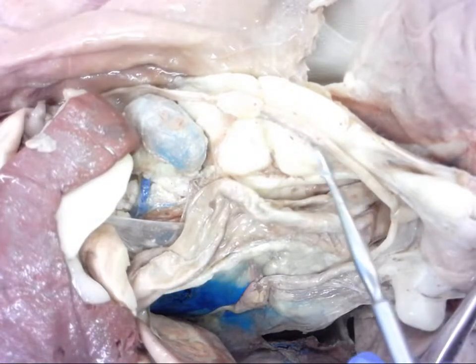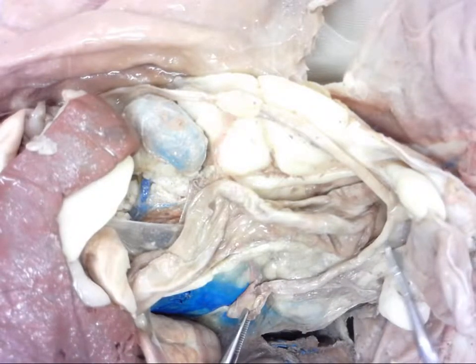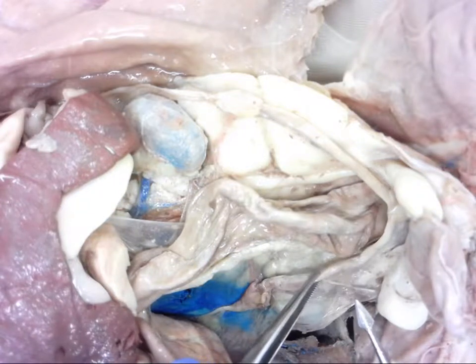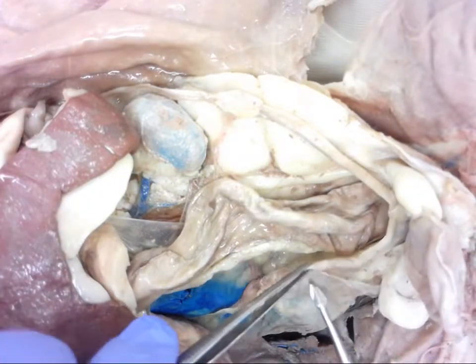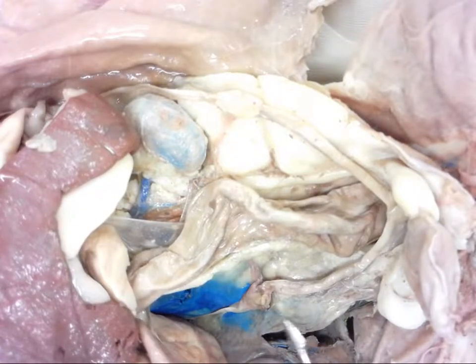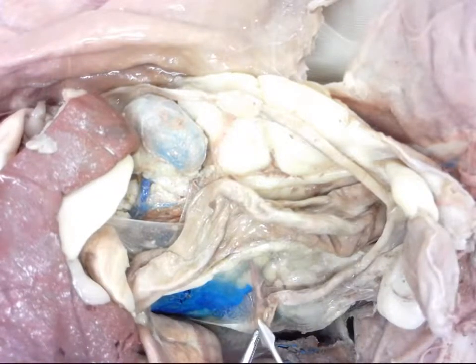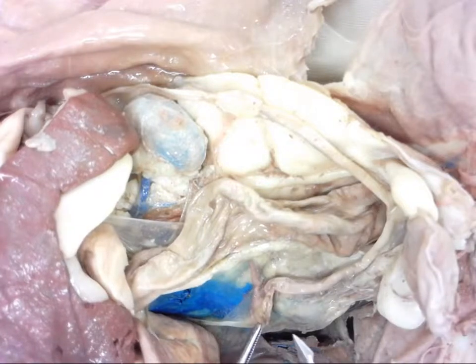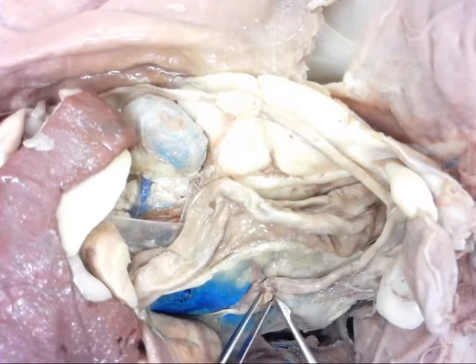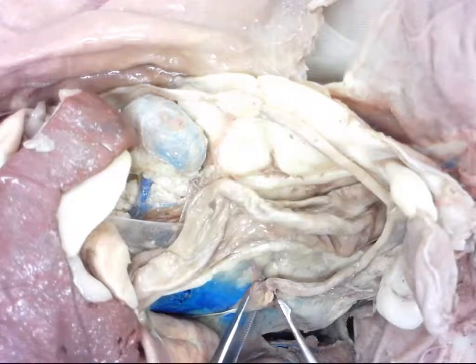These tubes are actually called uterine horns. This is where the offspring are going to develop - they may implant here and here and here depending on how many there are and start to grow. These uterine horns are actually going to be attached to the abdominal wall with a membrane. If we wanted to cut through it, it's a fairly small membrane and it is very similar in looks to the mesentery. If we follow these up you'll actually see it ends - there's an artery that comes out.